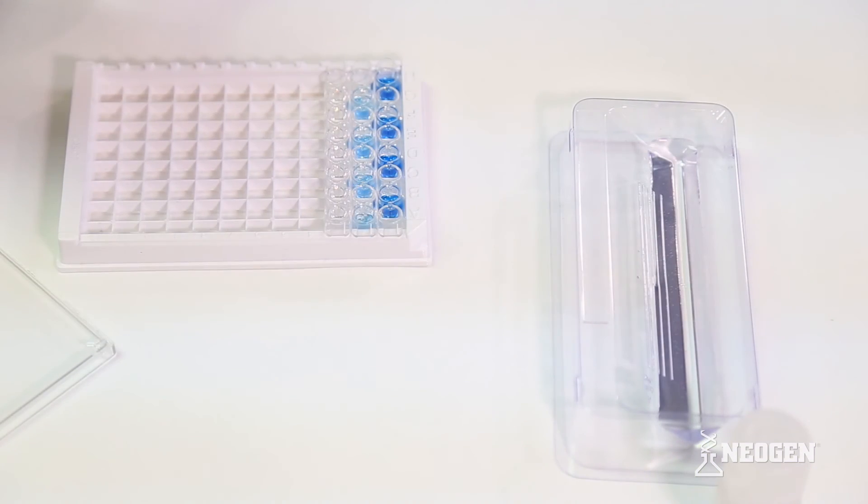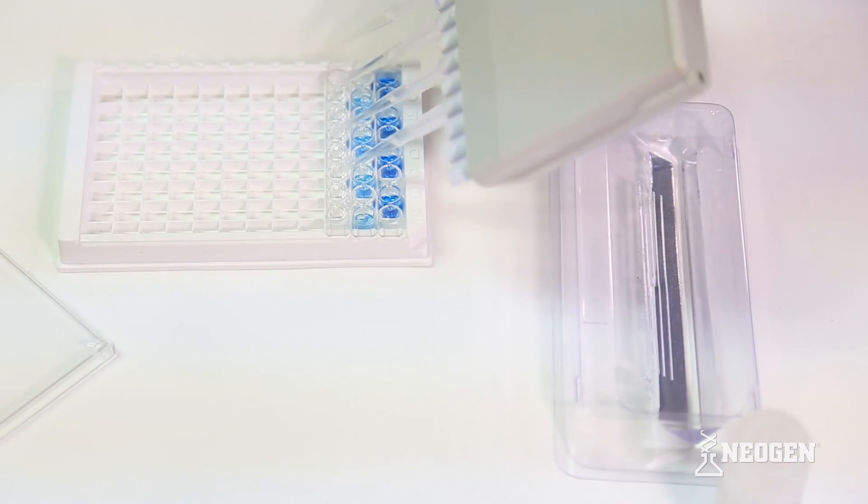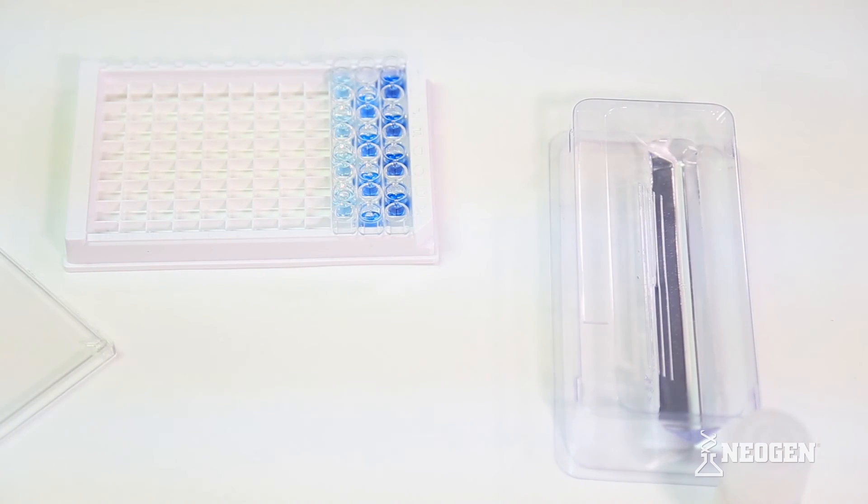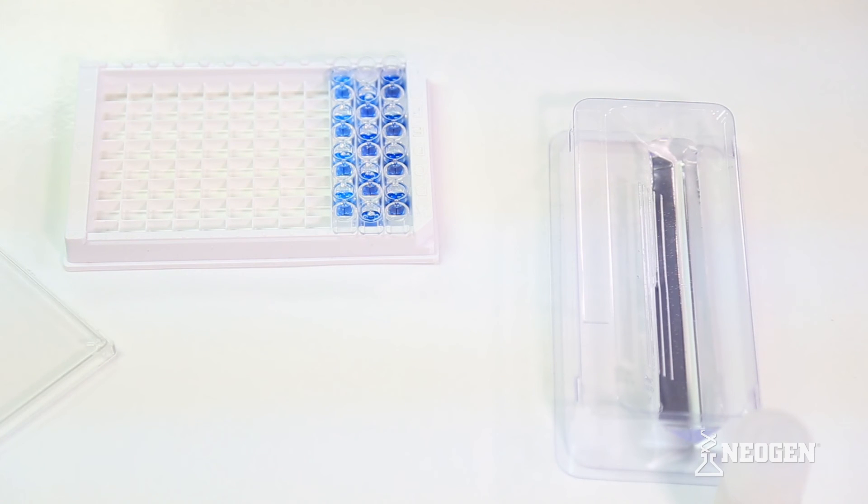After the wash step is complete, add the specified volume of K blue substrate to each well using an 8 or 12 multi-channel pipette for rapid addition and best results. Cover the plate and allow the substrate to incubate for 30 minutes.